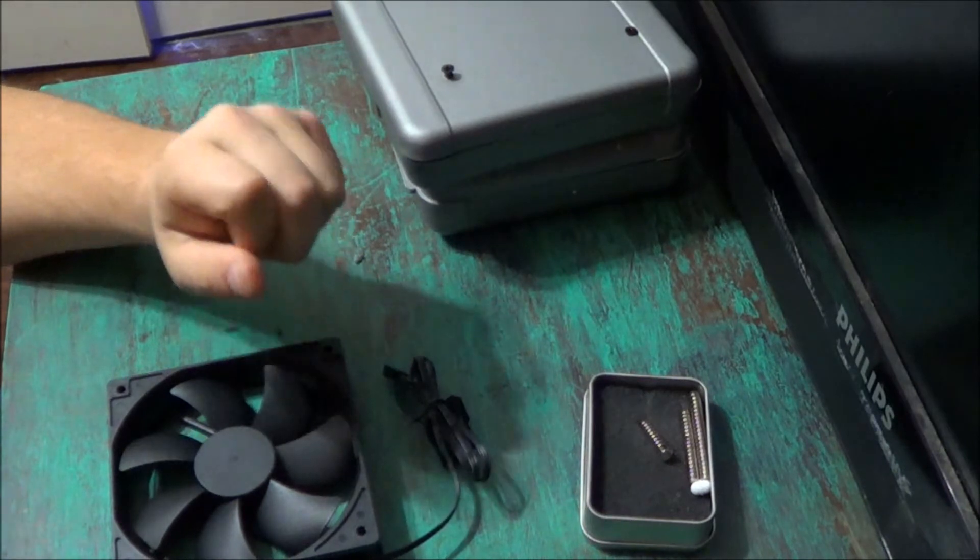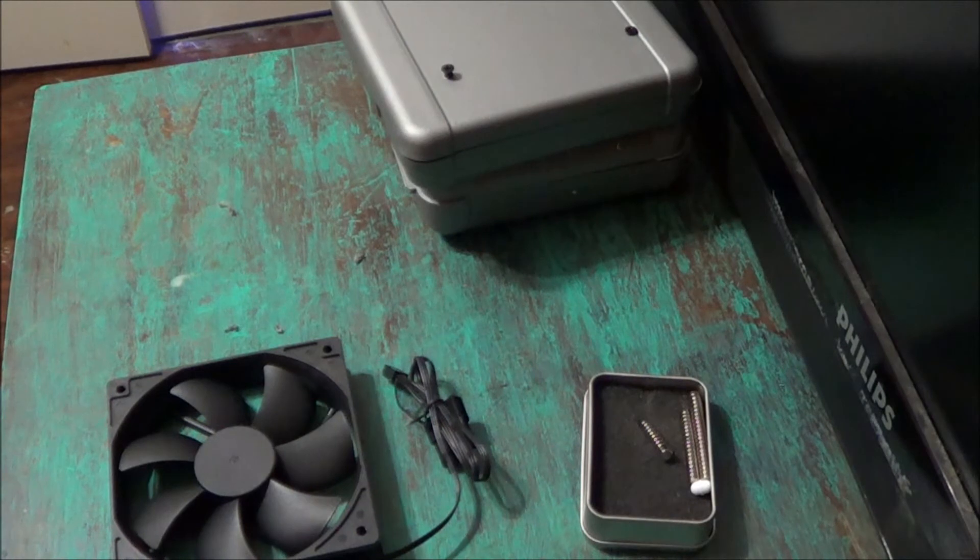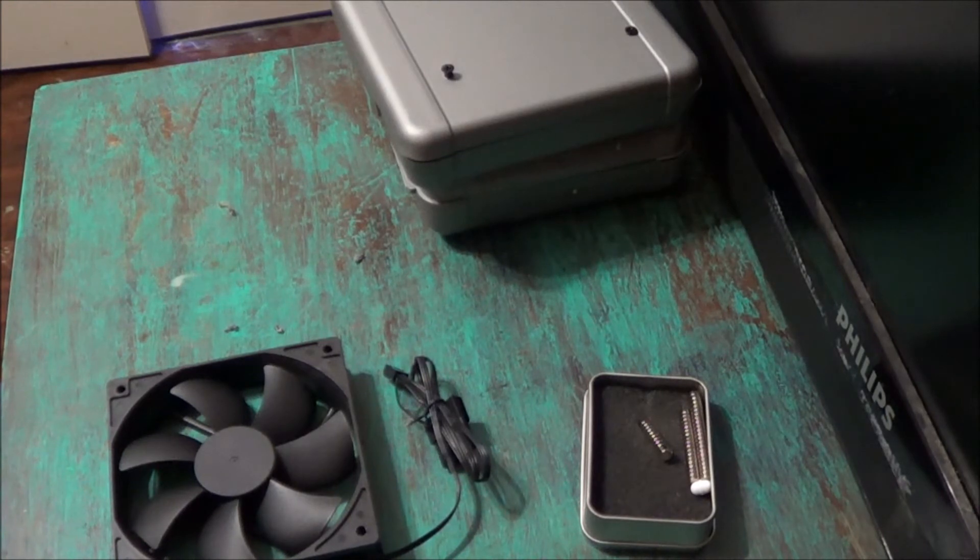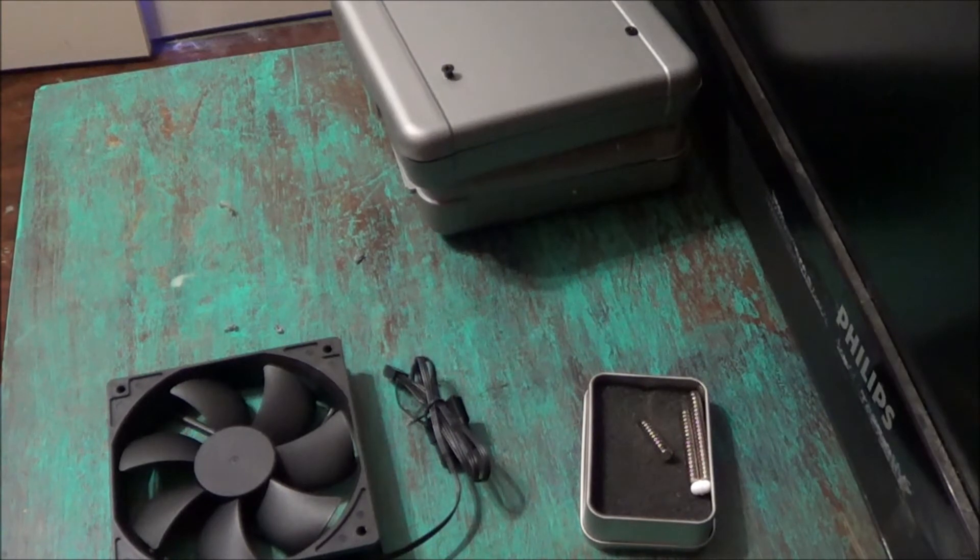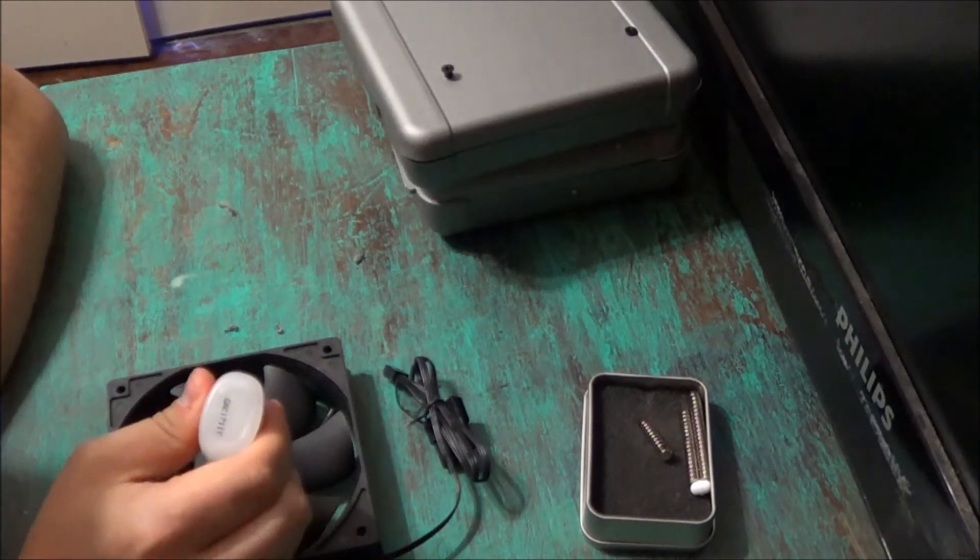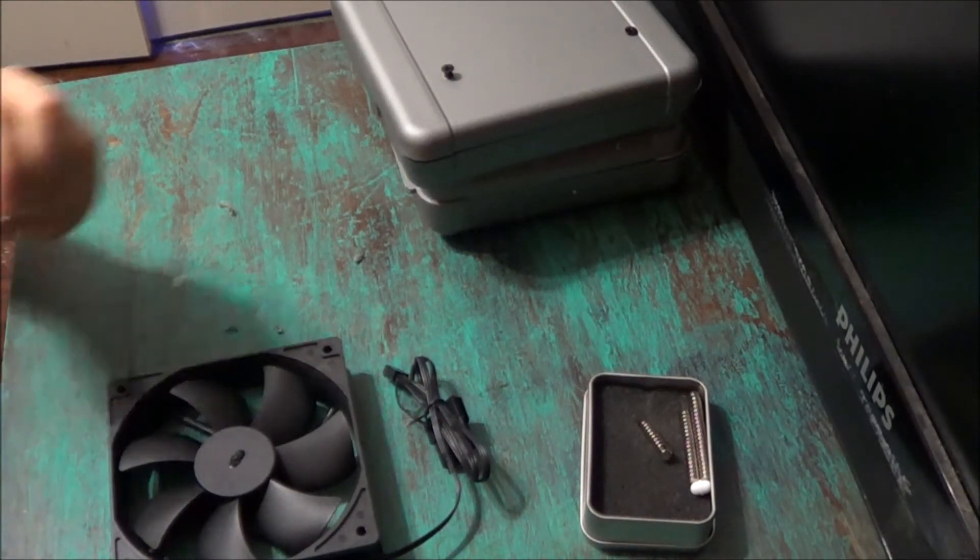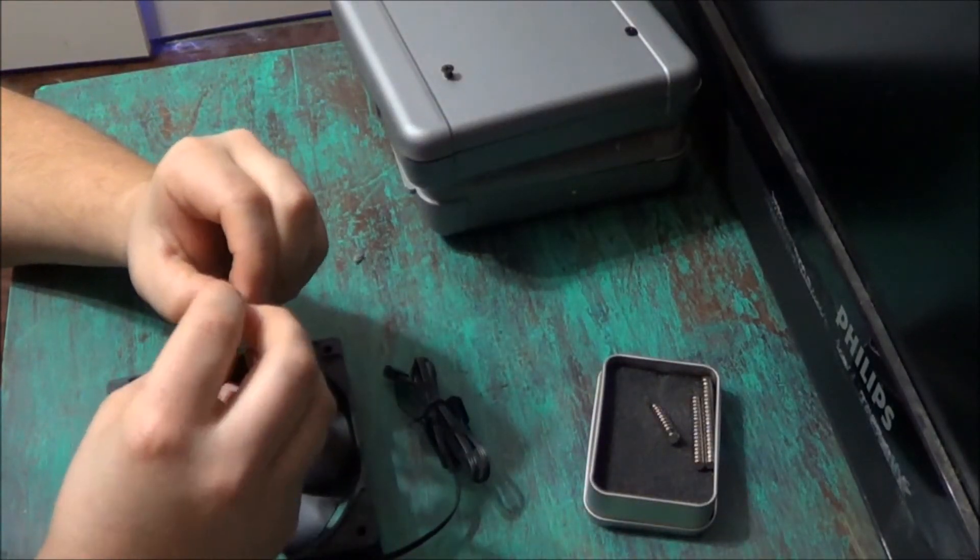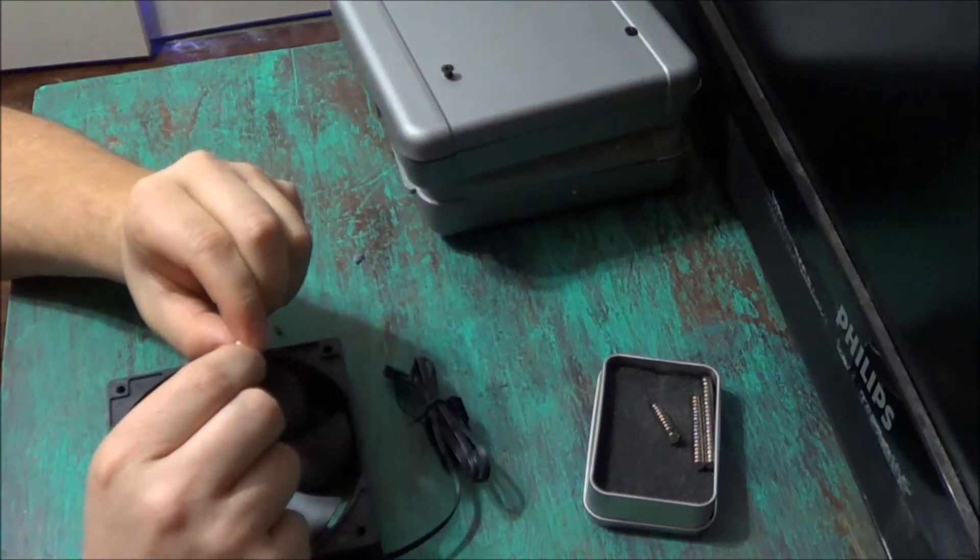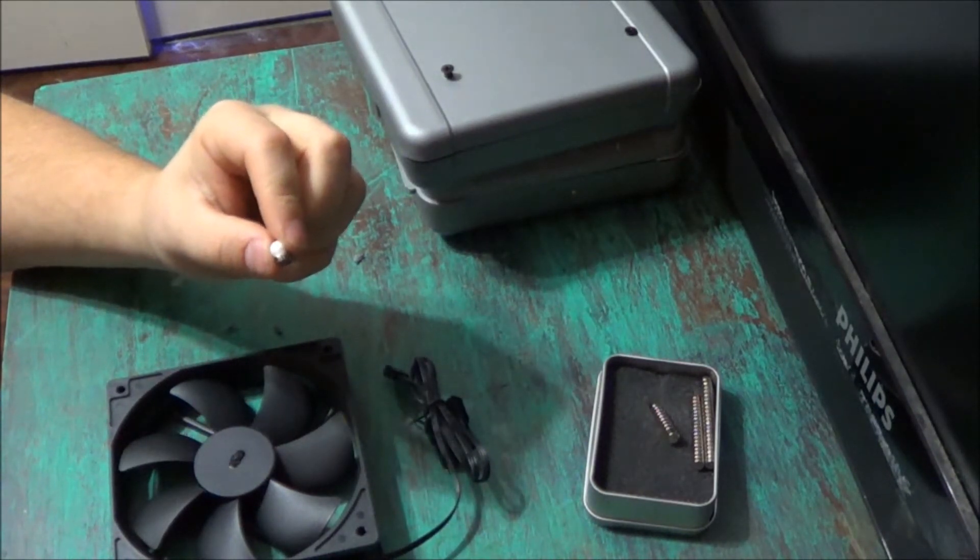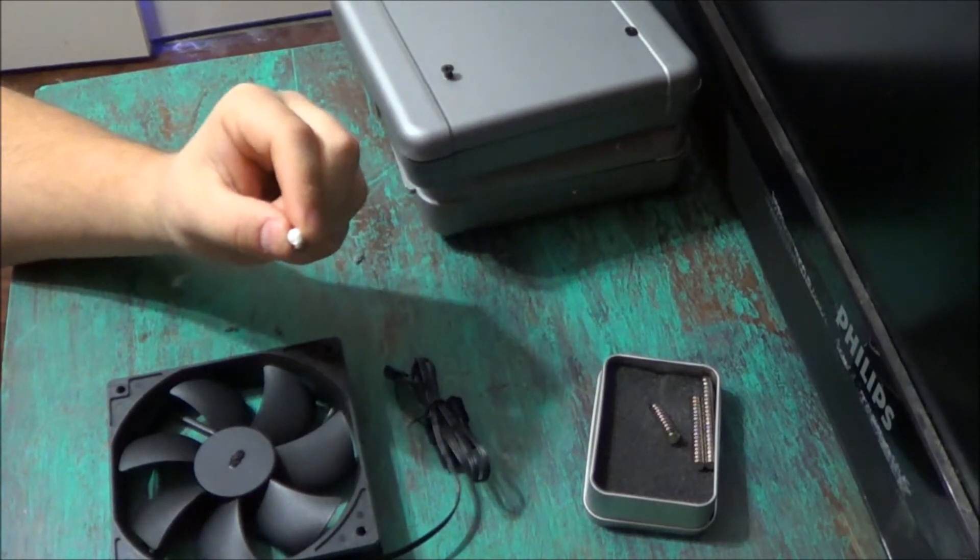I'm going to set those little magnets aside. Now I'm going to open my glue up. Since it's a gel, I'm going to shake it just a couple times. Now I'm going to put a couple dots on the center of the fan, just enough for my magnets to stick to. And if you're worried about not having your poles opposite of each other, just put your little magnetic stirrer on top. And you can even use that as well to hold the magnets when you go to place them on the fan. This is going to take just a little while to dry. So that's why we're doing this at this step.